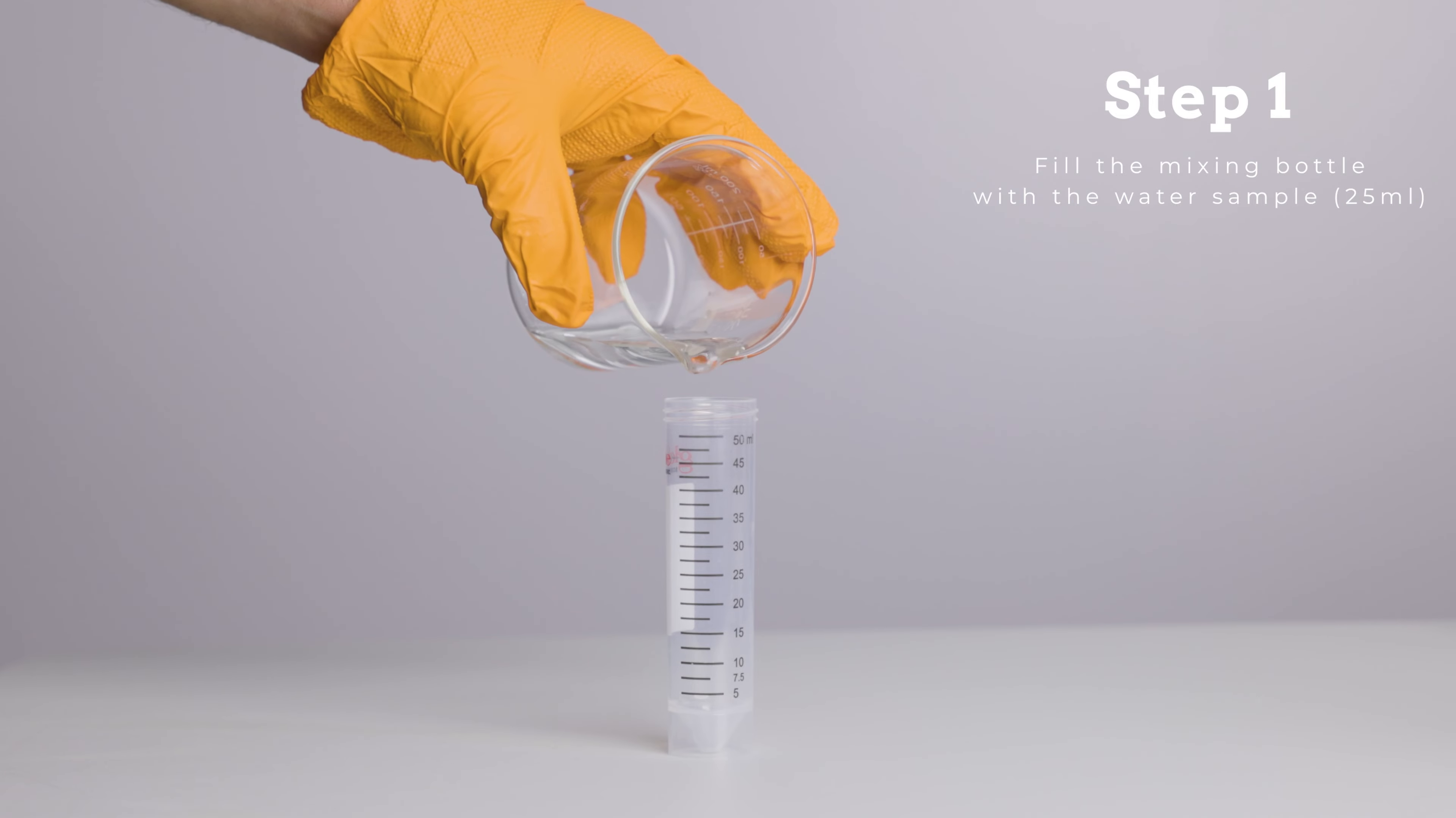Step 1. Fill the test bottle with the water sample to be tested to the top of the etched mark.